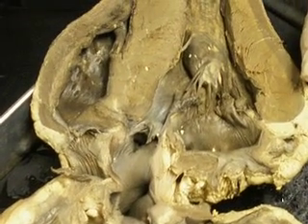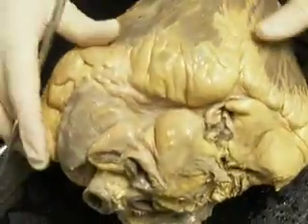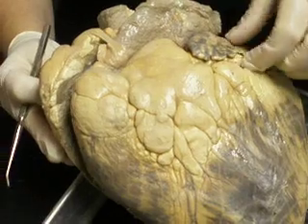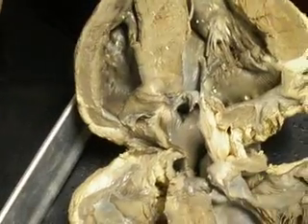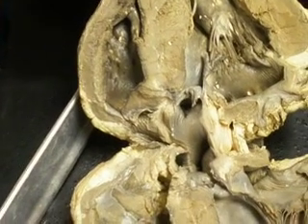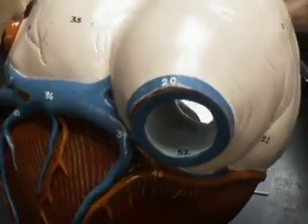The auricle is normally on both atria. Yeah, you have two auricles. You have one auricle here and one here. Just a flap. And then the coronary sinus, that opening is going to be into the right atrium. Right, right. Okay. So you can see like two openings, but it's still one hole because that goes in and then you can see it from the inside too. Coronary sinus into the right atrium.